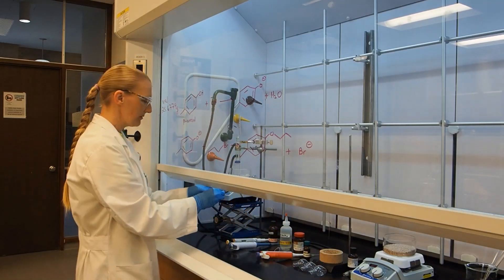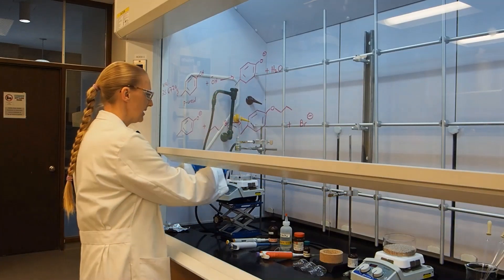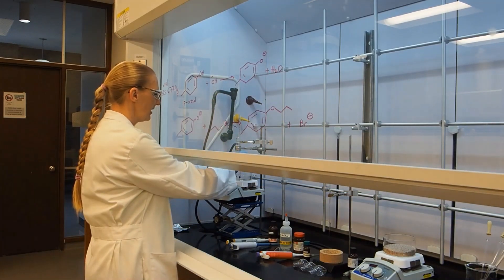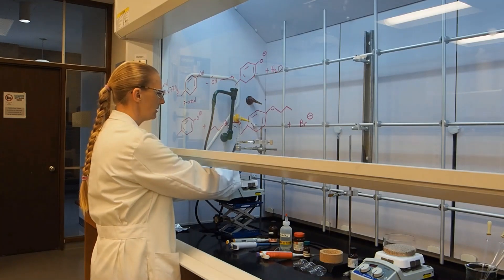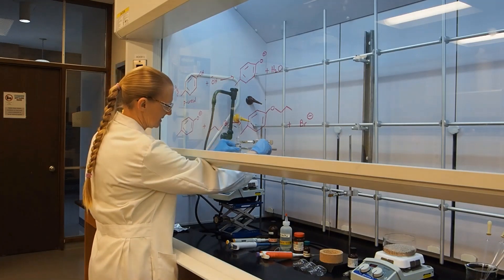So now all I have to do to get my reaction started is attach my vial to the condenser and lower the whole apparatus into the oil bath.